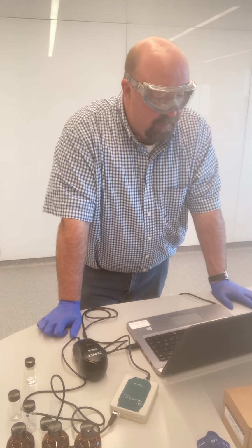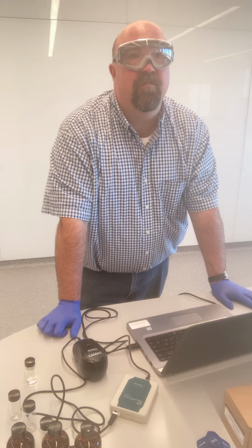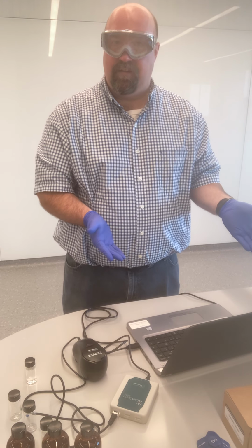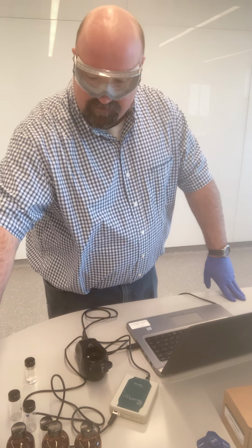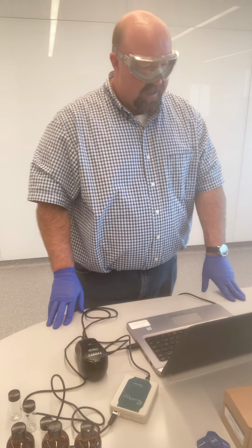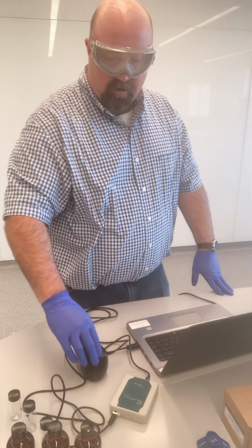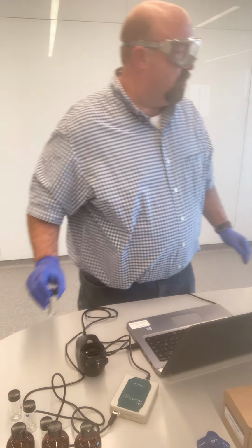If I put the 100 back in there and it was reading 64, or it was reading 172, then there's a problem with my calibration. I'd want to go back and recalibrate and try to fix that. But I can see that it is reading pretty accurately. My water should be reading pretty much at 0, so let's check that. Sure enough, 0.2. So that's pretty darn close. And so my instrument is now calibrated and ready to use.